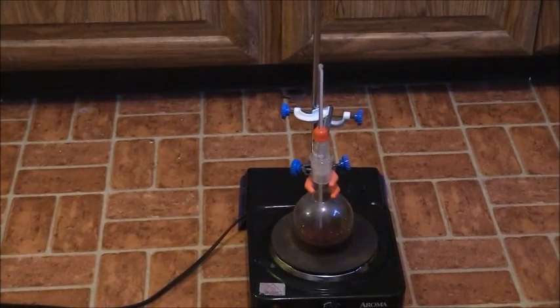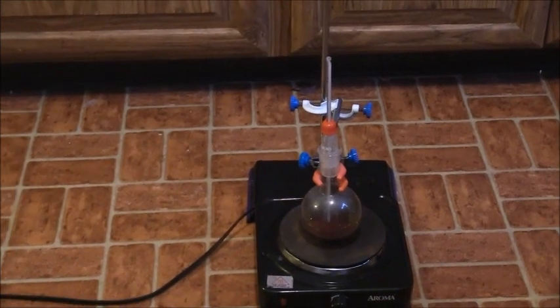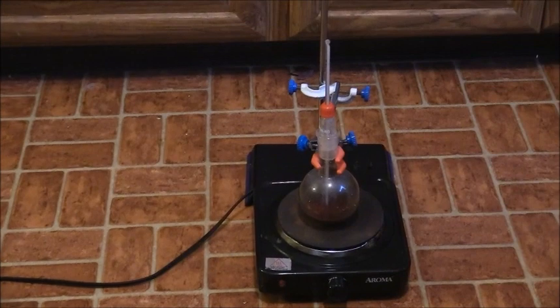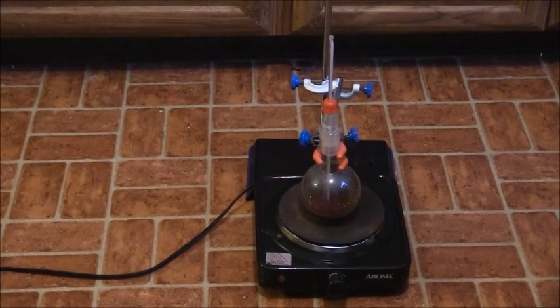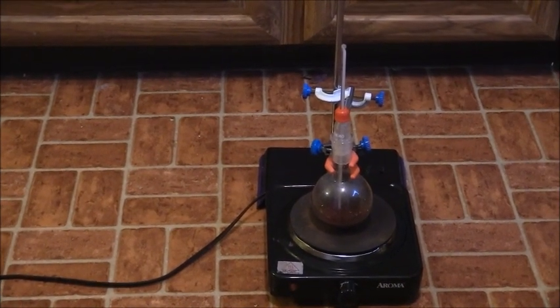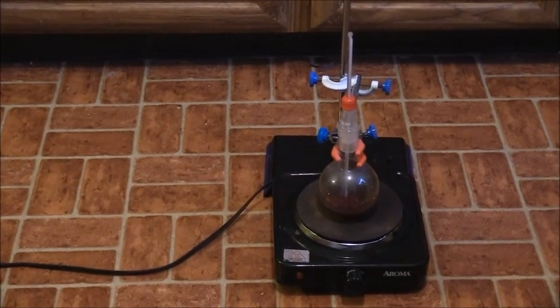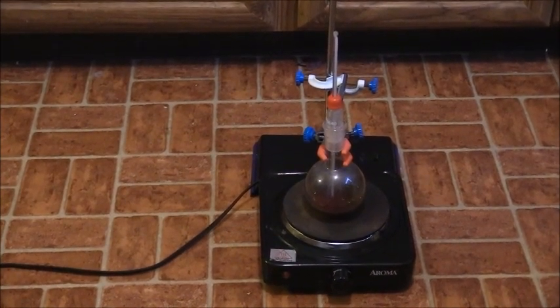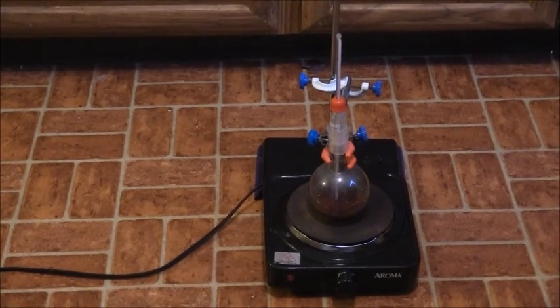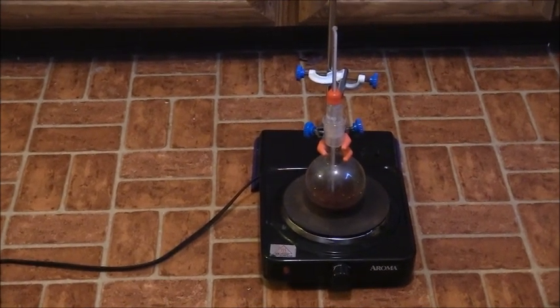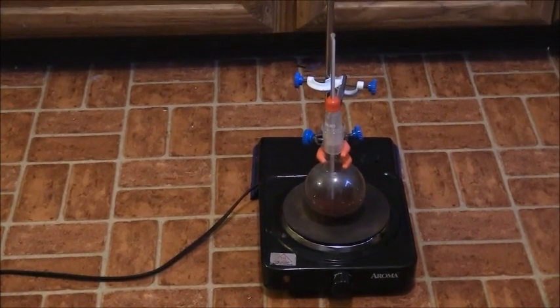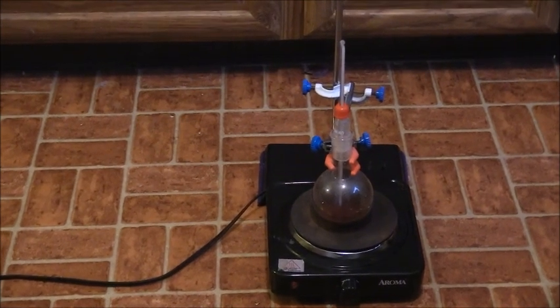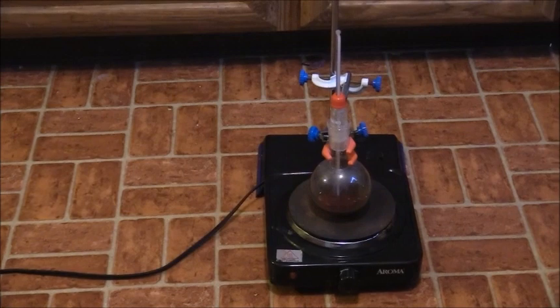And some of that hydrogen cyanide can form polymers where you have two or more cyanide units linked together. And in the pure form, these polymers would be a black precipitate. However, maybe there is a small amount of polymers present with not enough to form a black solution. So possibly this is why the solution is reddish brown. But anyway, I'm going to stop this experiment now at the 36 hour mark and I'm going to test the solution for purines. And we'll see if any purines were produced.